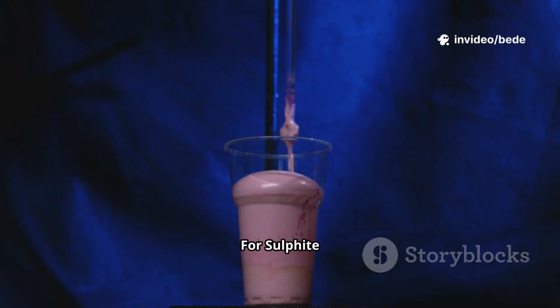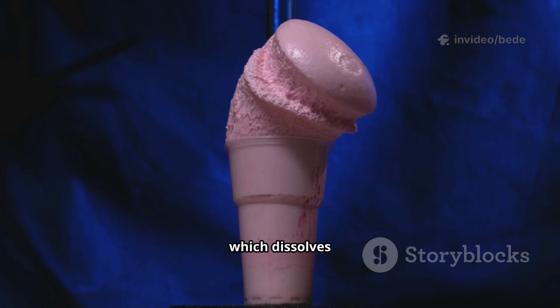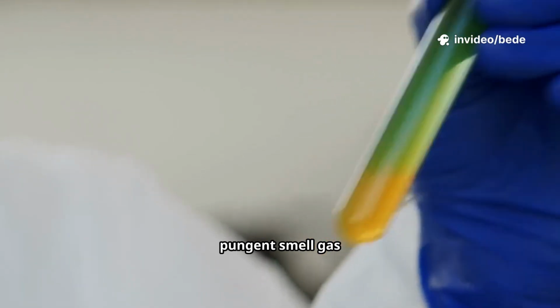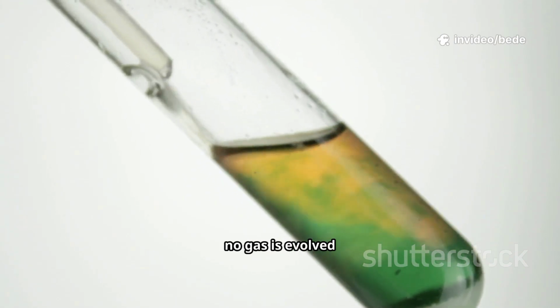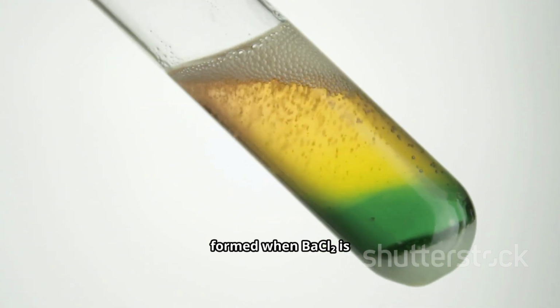2. For sulphite ion, a white precipitate is formed when BaCl2 is added, which dissolves with effervescence when HCl is added due to liberation of SO2. SO2 is a colorless, pungent smelling gas which turns acidified potassium dichromate green. 3. For sulphate ion, no gas is evolved when HCl is added. A white precipitate insoluble in HCl is formed when BaCl2 is added.